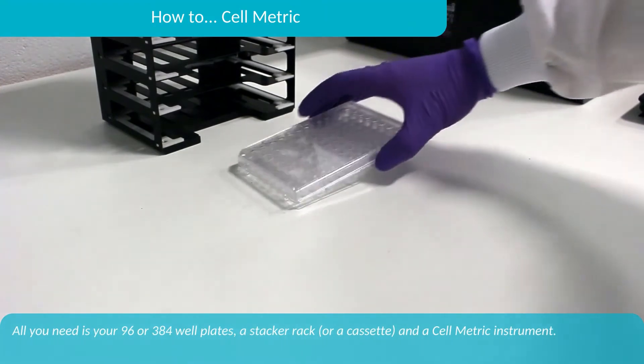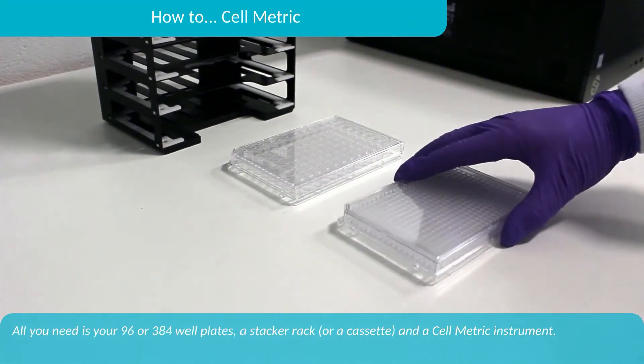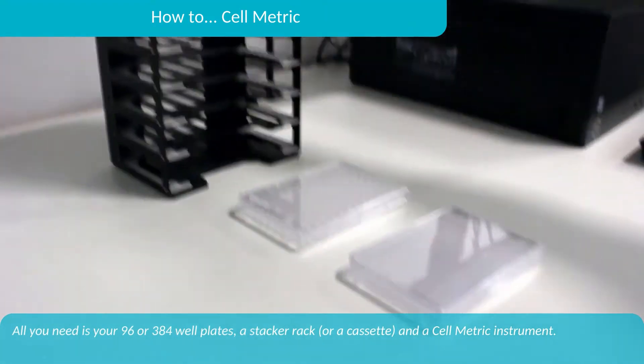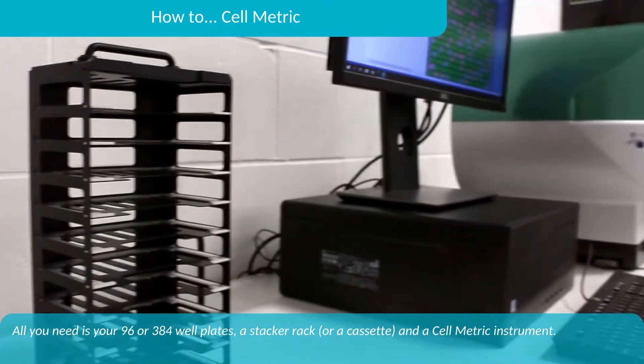All you need is your 96 or 384 well plates, a stacker rack, and a Cellmetric instrument.